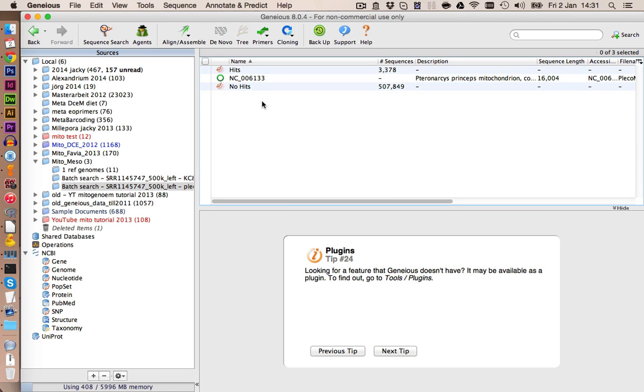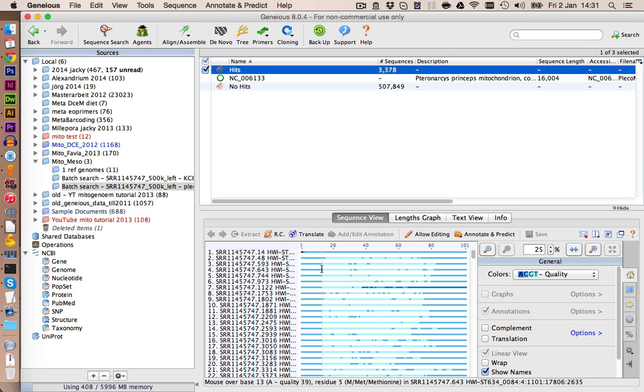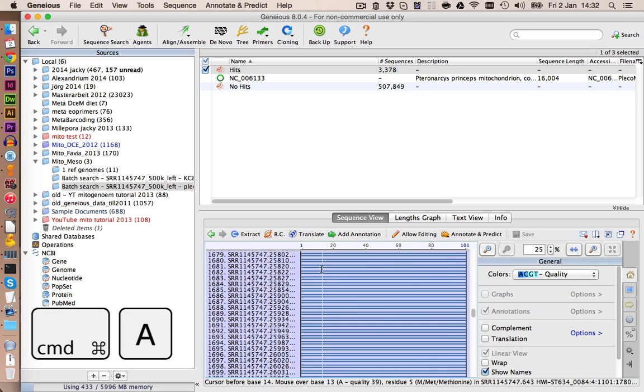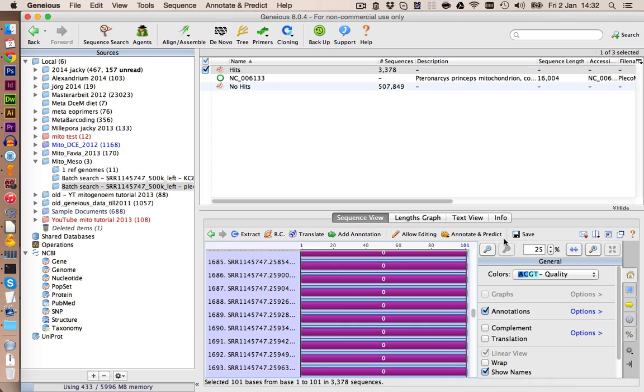As we are going to use several BLAST searches and several mappings, I want to make sure that I can trace which hits are from which BLAST search, to get an idea what the progress is in each search, if we can add some new hits or if we can't. So what I would do is always annotate the hits from one BLAST search. You click on the file, you press Command A, and now we have selected all of them, and we click on Add Annotation, and in here we name this one 0. So we just make it running numbers, and we will take another motif each time to change the color. Of course, this should be undirected, and we can click on OK and on Save.